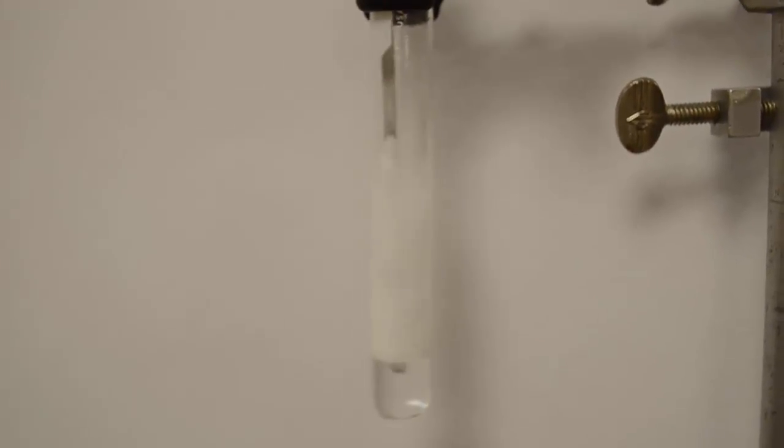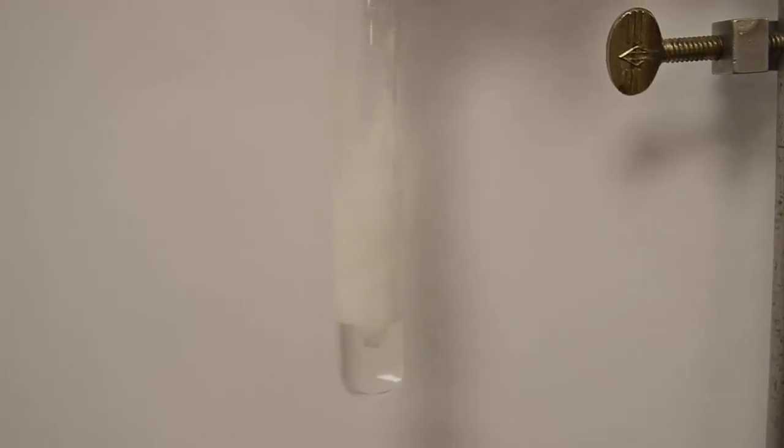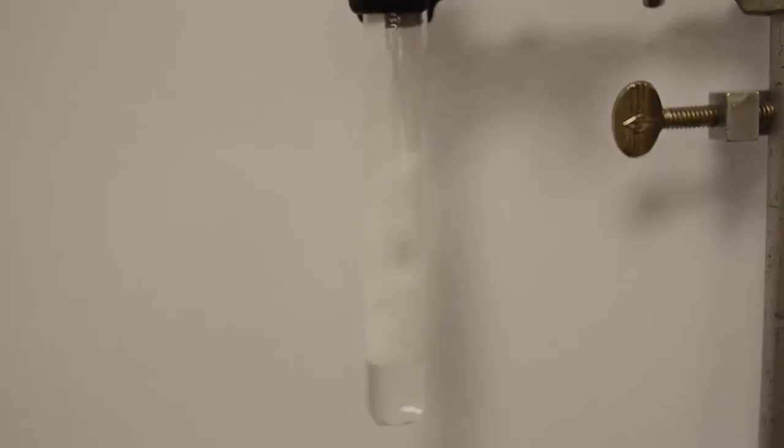So if I put magnesium into concentrated hydrochloric acid, we get a redox reaction occurring in which the magnesium is going to lose its electrons to the H+ ions in the acid, which is going to turn it into hydrogen gas, which is why you see all the bubbles. Now the question is, well, why does that happen? Why does magnesium lose its electrons to the H+? And the answer to that has to do with the relative activity.